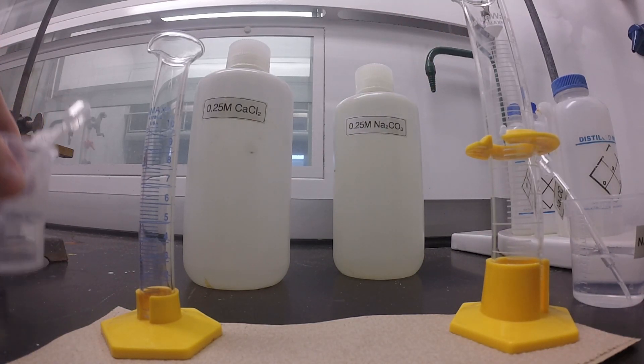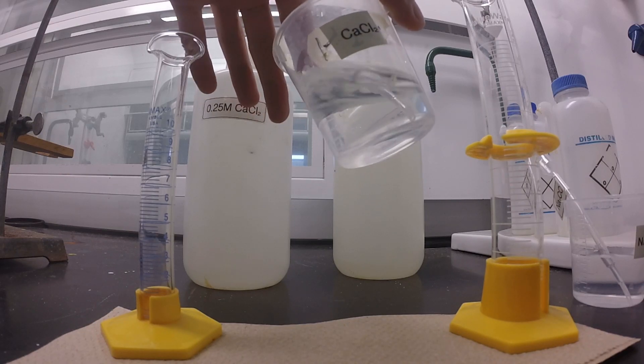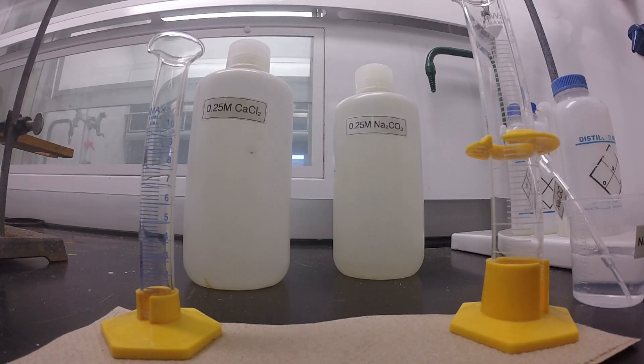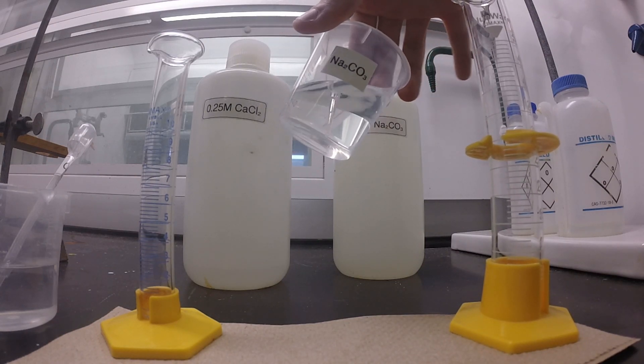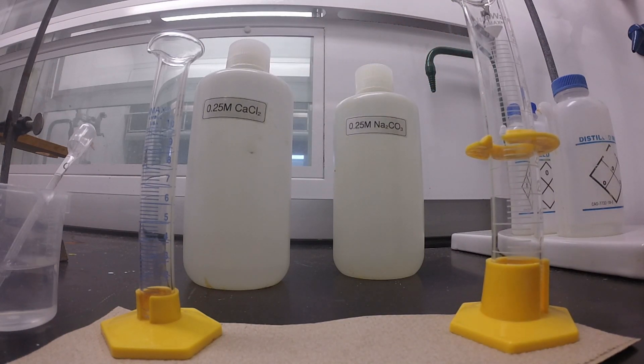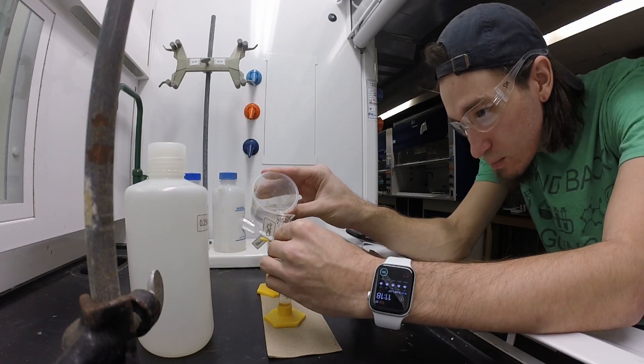You can see each of these solutions are clear, and this is to be expected as both calcium chloride and sodium carbonate are soluble according to our solubility rules.